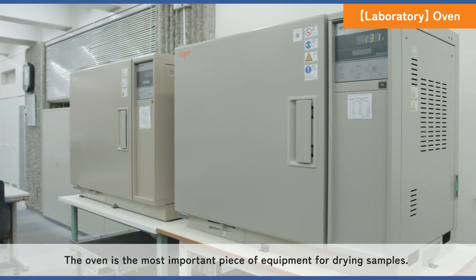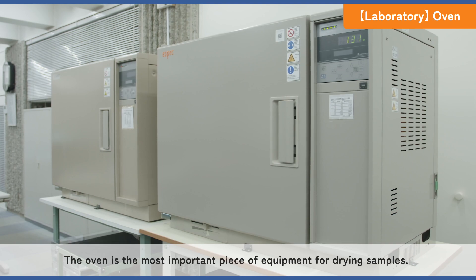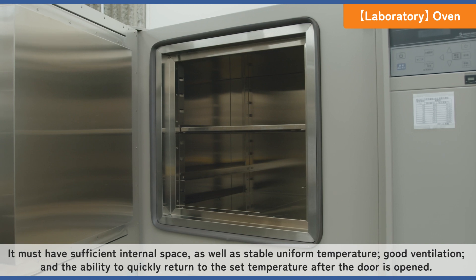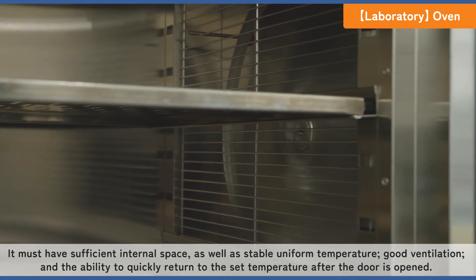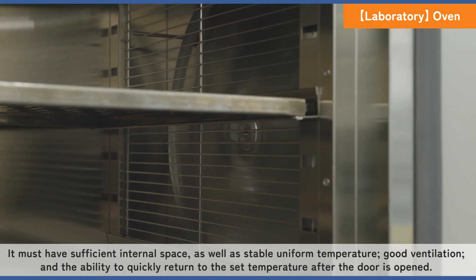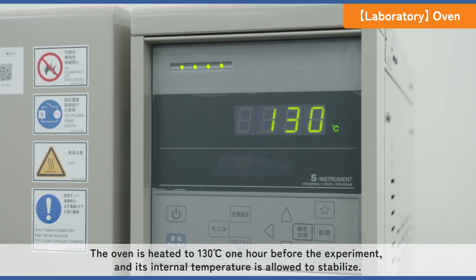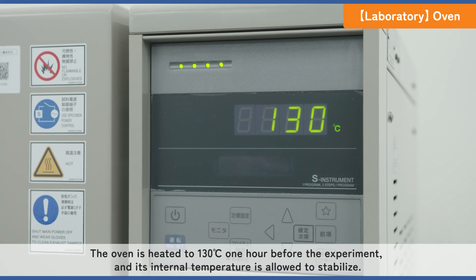The oven is the most important piece of equipment for drying samples. It must have sufficient internal space as well as stable uniform temperature, good ventilation, and the ability to quickly return to the set temperature after the door is opened. The oven is heated to 130 degrees Celsius one hour before the experiment and its internal temperature is allowed to stabilize.